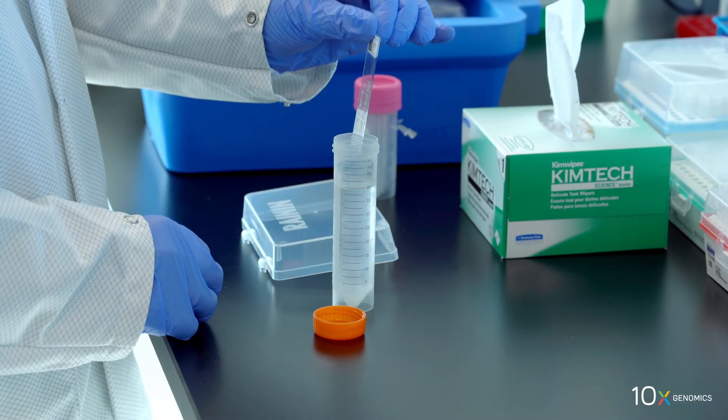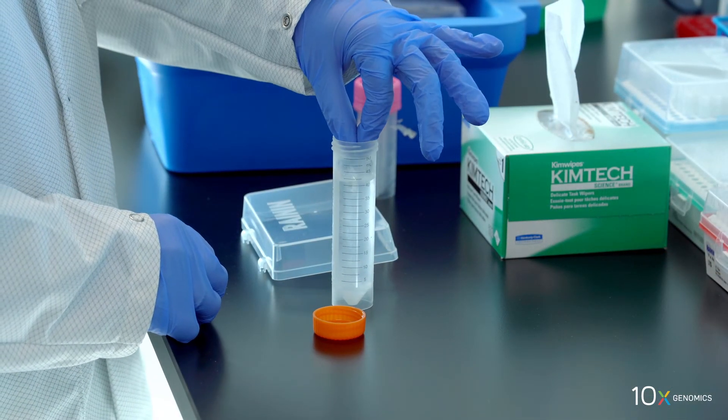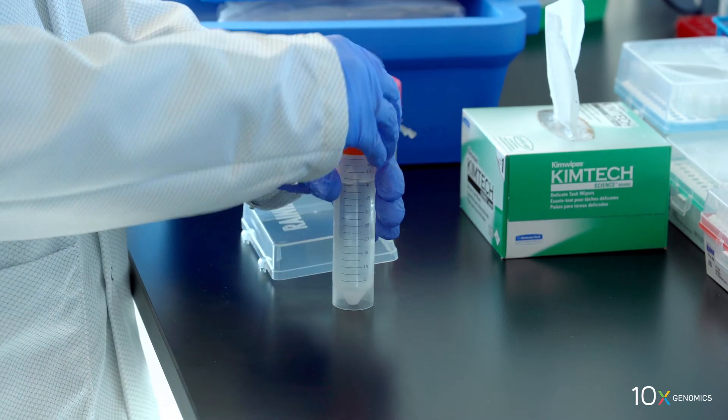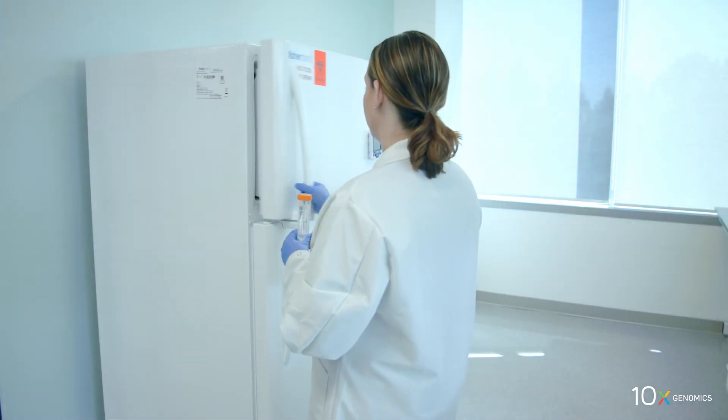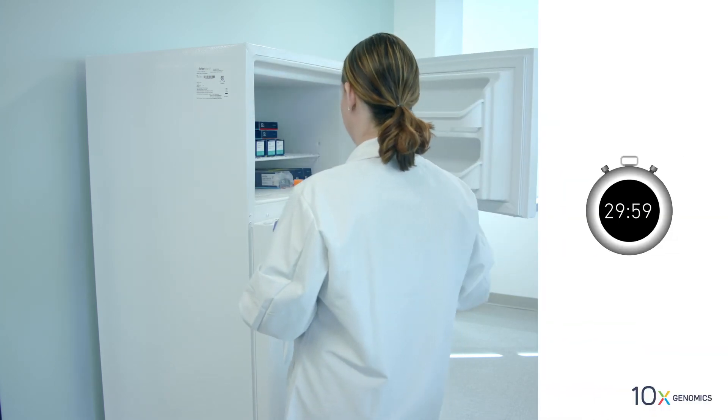Completely immerse the slide in the pre-chilled methanol. Secure the tube cap to prevent methanol loss. Incubate for 30 minutes at minus 20 degrees Celsius.